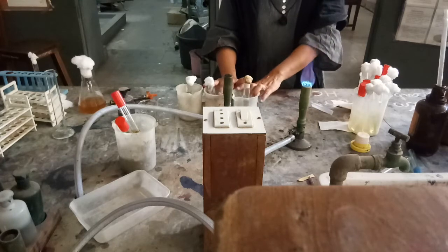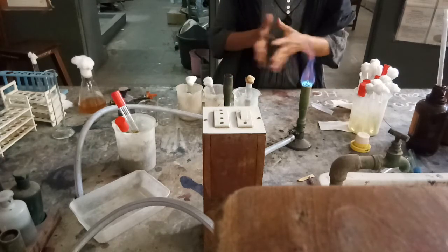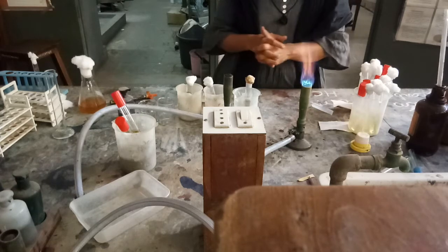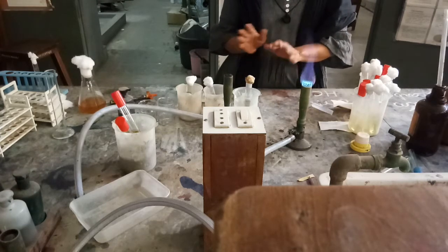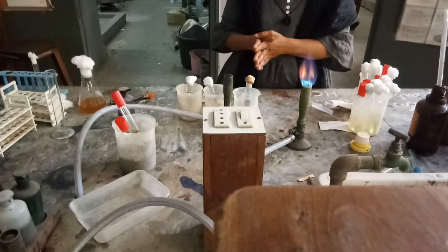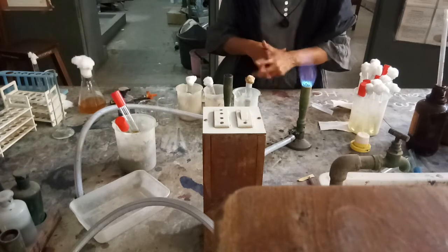For at least 48 hours we are going to incubate all our samples, and then we will compare with the control and finalize the result. According to the SOPs, we have to wait for seven days to confirm the result. Every day we will check the growth and confirm the sterility of this pharmaceutical product.